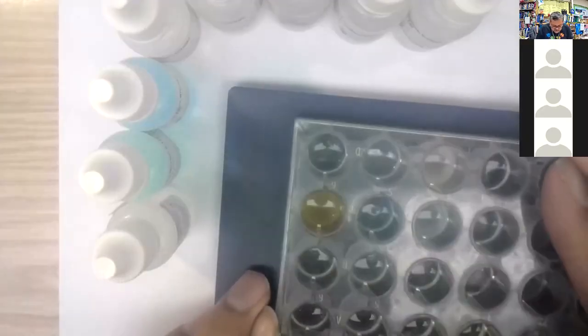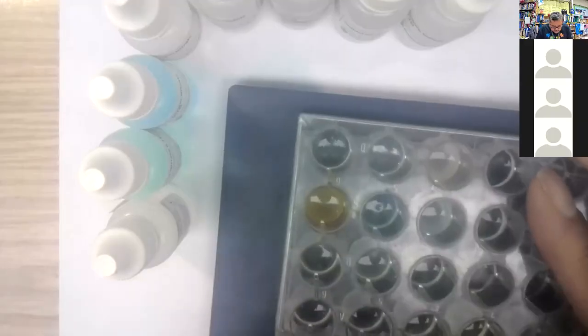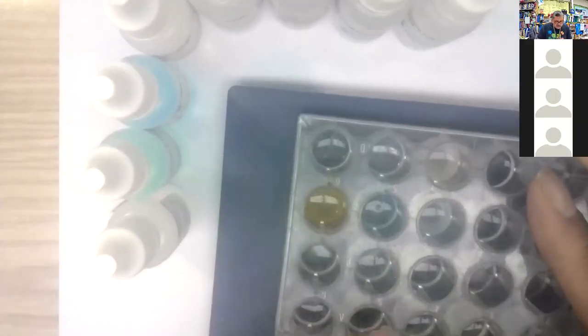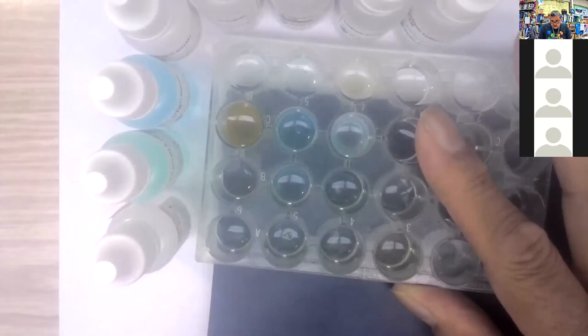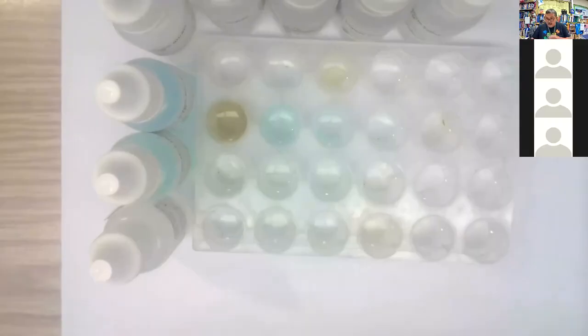Hard to see, but if any of them were precipitates, I would call it this one right here. Okay, the potassium hydroxide with the zinc nitrate. Oops, you can't see right there. The second one over, 4th row. All right. Okay. So some pretty good data. You should be able to work with that.